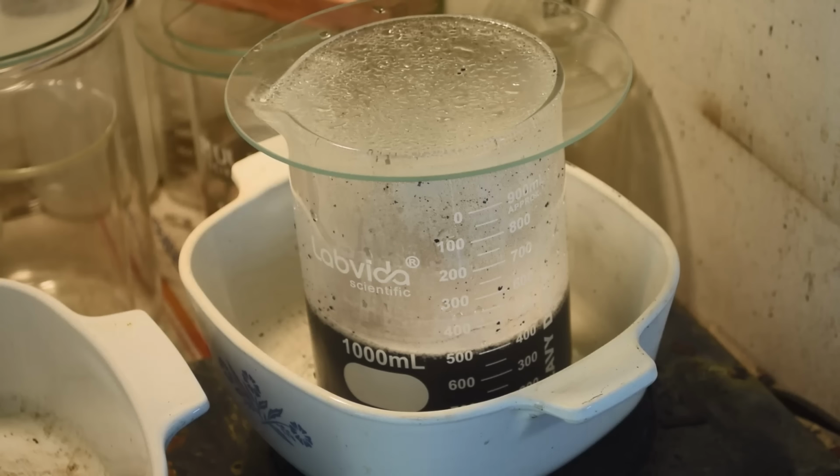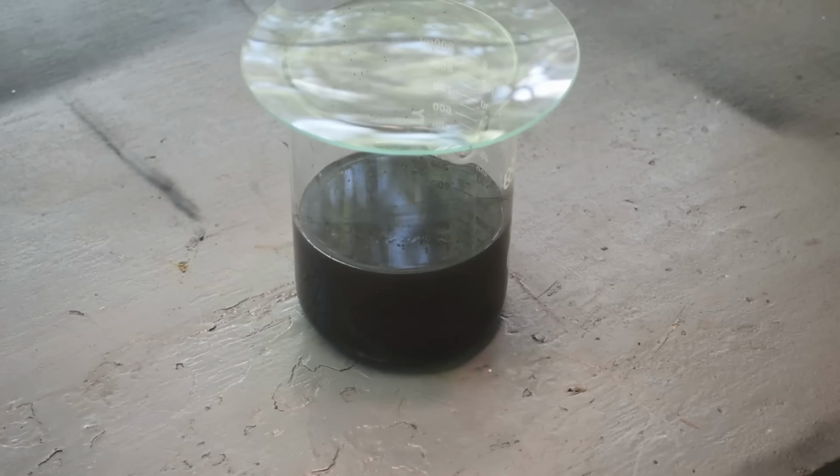So palladium, it's not playing nice. Not playing nice. But we will get it done today, one way or another. This project has gone on for way too long. So I'm going to give this a couple of boils, get it dried out, and we'll weigh it. Well, okay, this really isn't looking too good. Hope I haven't big time screwed the pooch here.